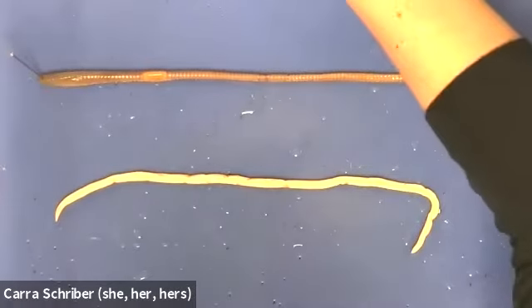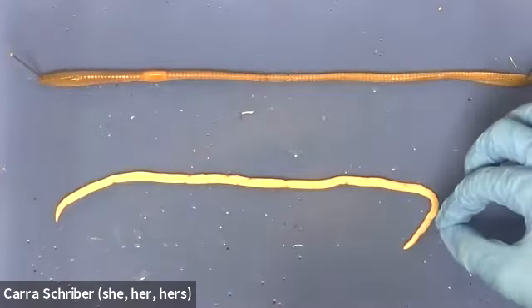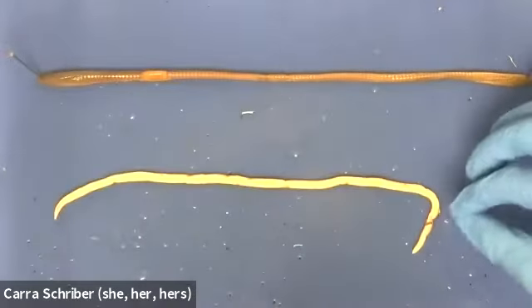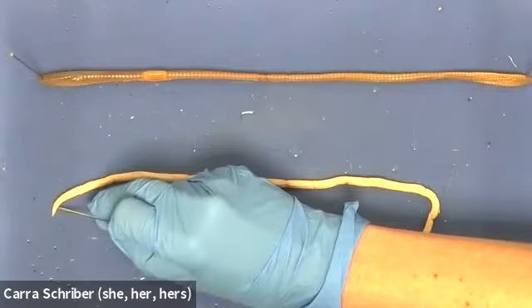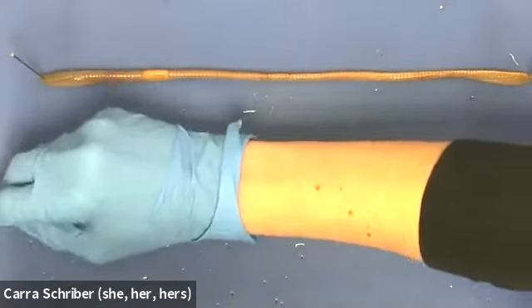All right, and then here we have our roundworm. This is a pseudocoelomate, and it's pretty hard to tell the head end from the tail end. But from experience, I know that this end that has a thinner tip is going to be our head region. So we'll pin that.